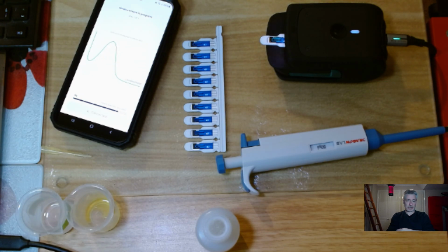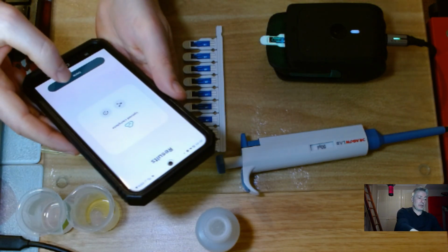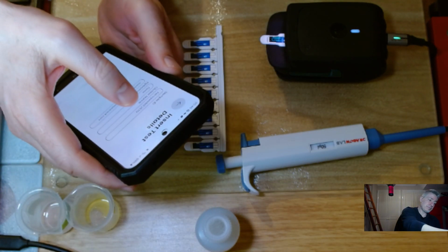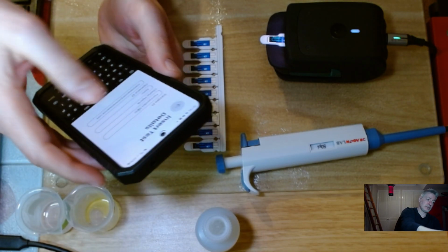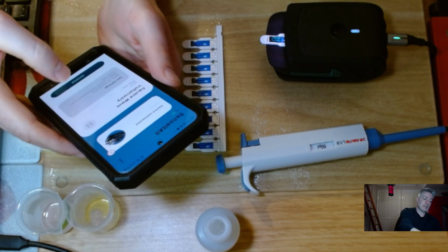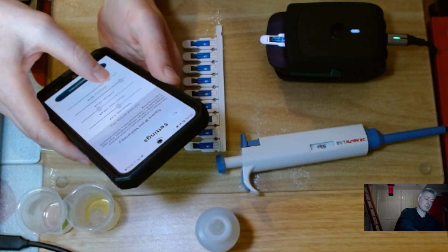Only a few more seconds. It'll probably say upload complete in a minute. Upload complete. Okay. Now I'm going to change the file name to 50 hertz, so I can find it in a minute. Then I go continue, and I'm going to set the settings here to 50 hertz.